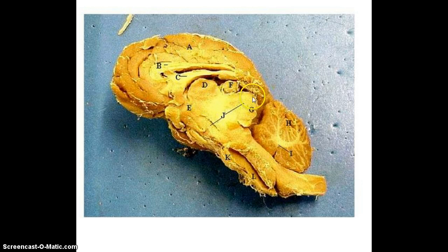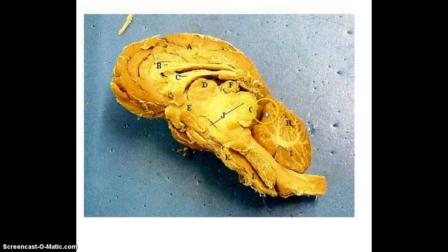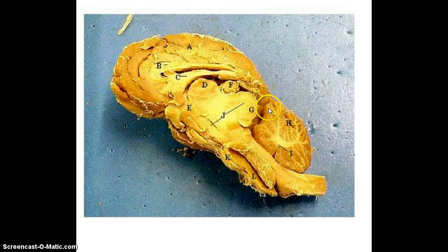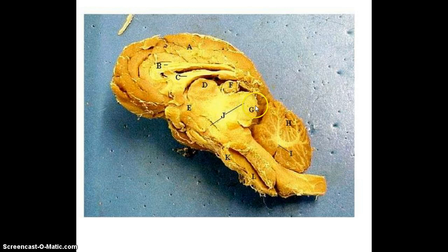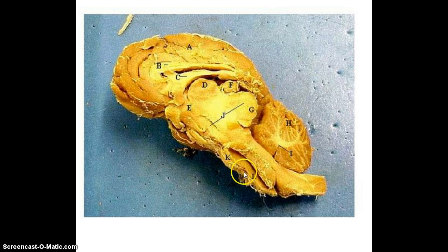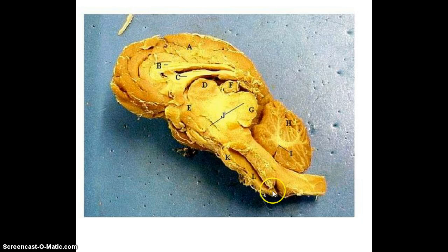Back here is the corpora quadrigemina. You can actually see it better on a sheep brain than you can on the models. That transverse fissure between the cerebellum and the cerebrum — if you separate them through that fissure, it looks like a little person's mooning you, like a little butt looking at you. That's the corpora quadrigemina. Here we have going into the brainstem the pons, and below that the medulla oblongata, and then you get into the spinal cord.